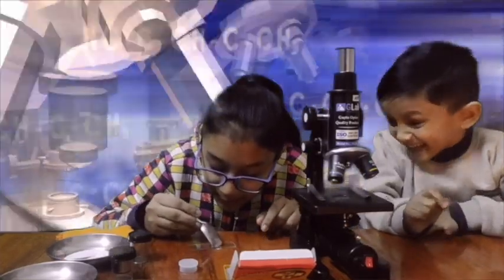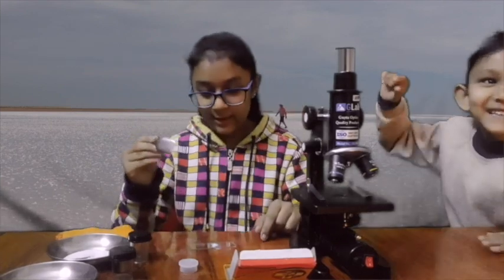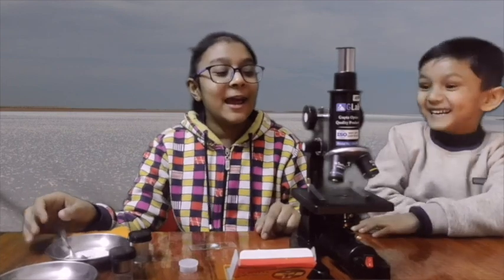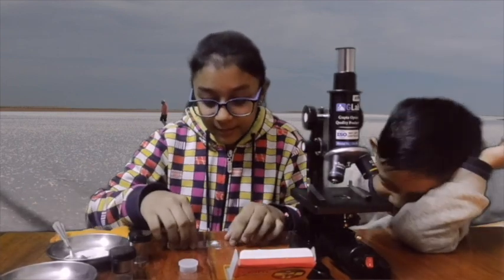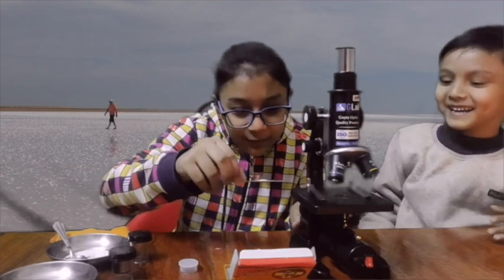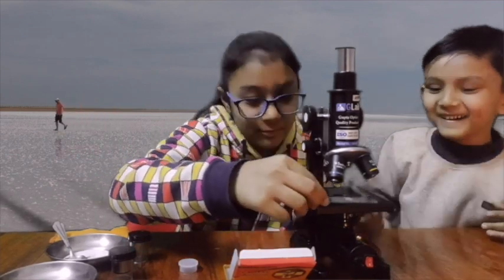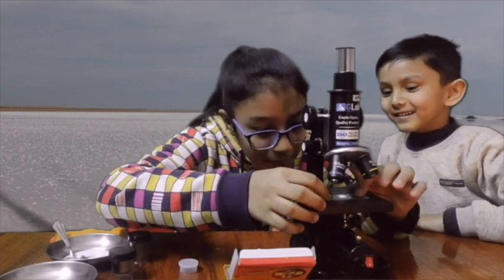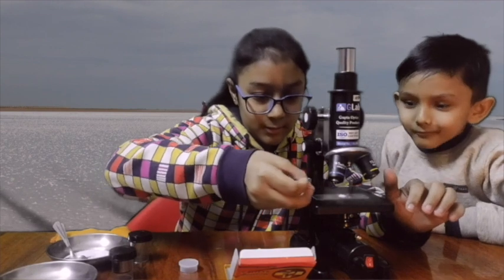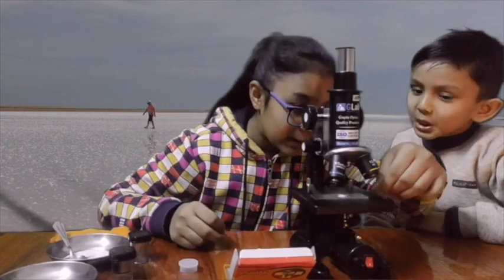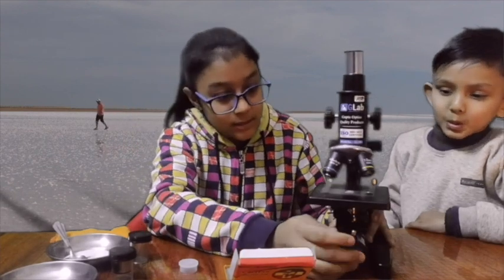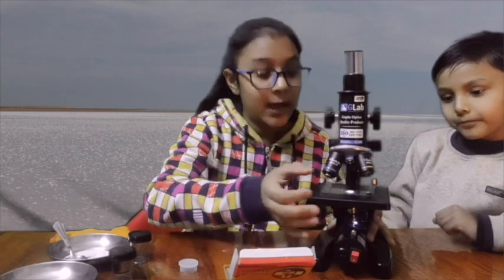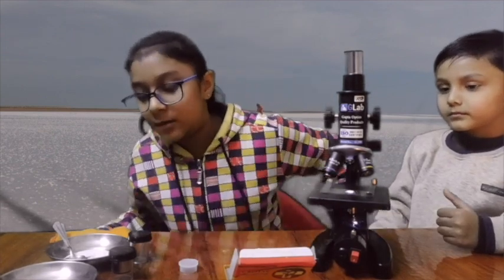And then I am going to put it like this. Okay. Enough for the laugh. I am going to do this very carefully and put it here like that and put on the light. Oh wait.